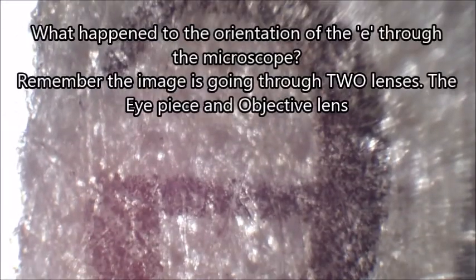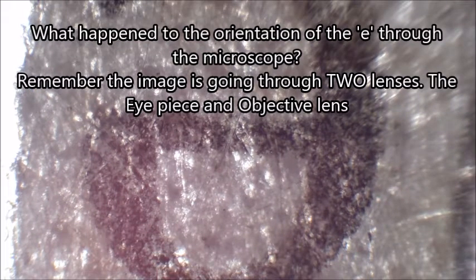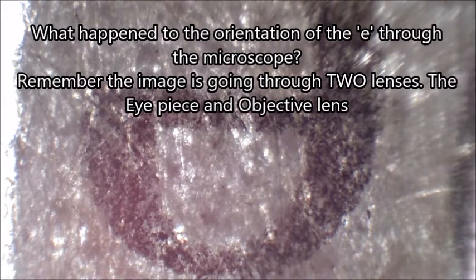Now, what's interesting about this is when I look at my slide, the E is up the right way and facing the right direction. But when we look at it through the microscope, it doesn't look like it is around the right way. Can you see how it has altered the view, or the direction of the E?